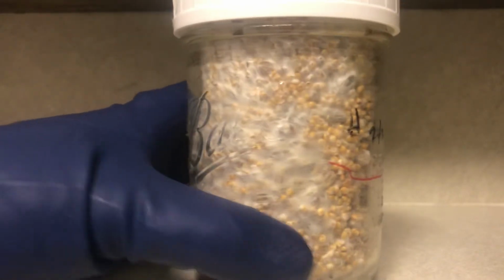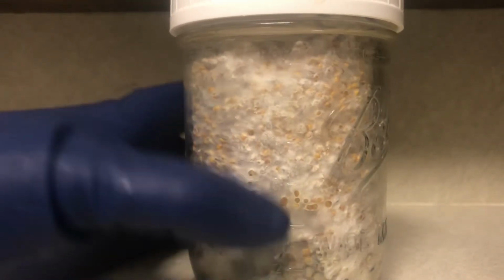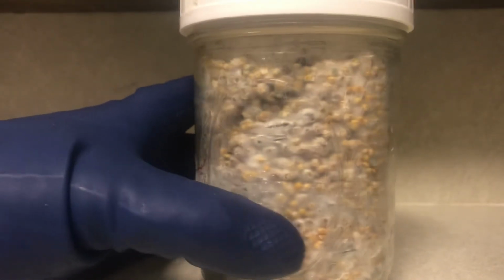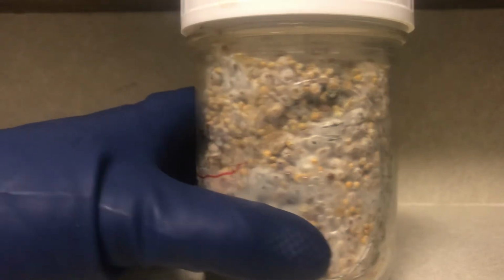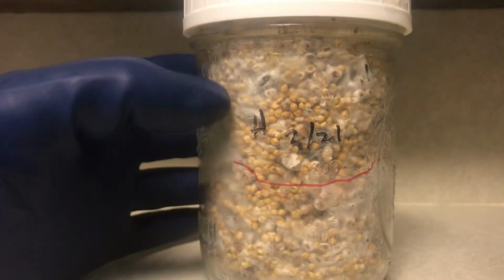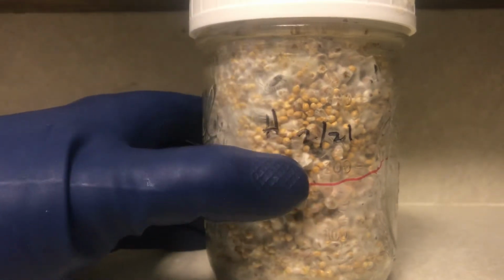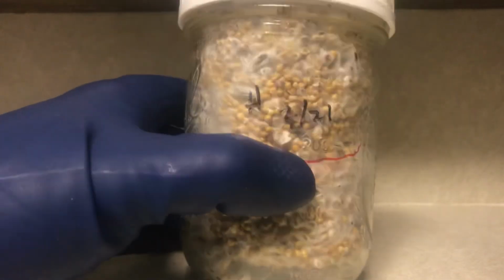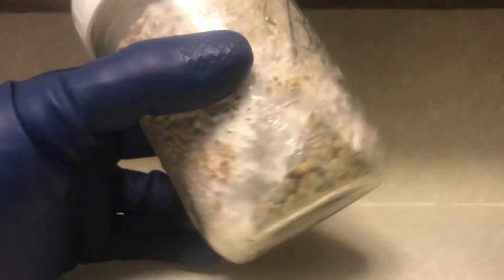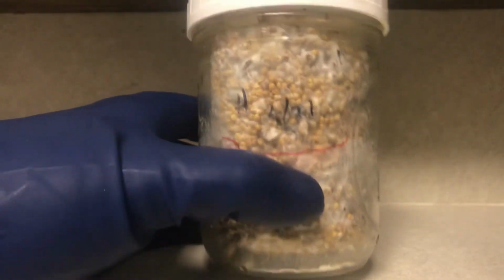This is oyster mushroom mycelium, and it grows pretty good, and because of that it can also hide some contamination. But if I was to transfer this to wooden pellets and try to mix it with other grain spawn, or try something where you cut off where you think it's not contaminated, all that is just not worth the effort. You won't get good results that way. So when you get jars like that, even with a small spot, just get rid of it and use jars that you know are good.